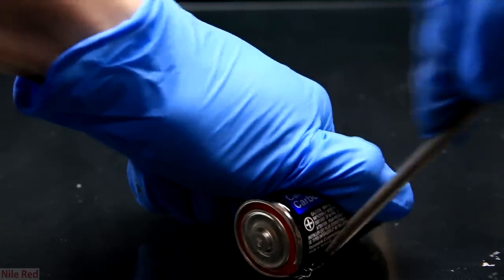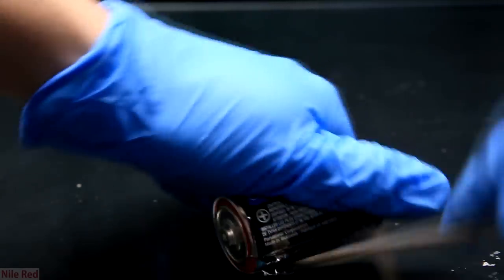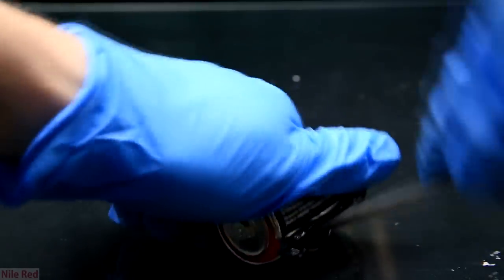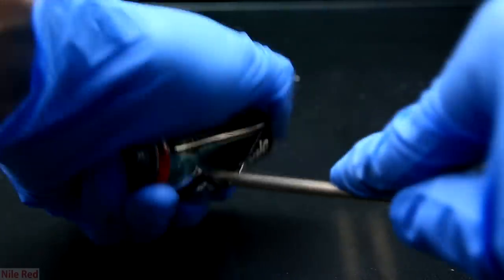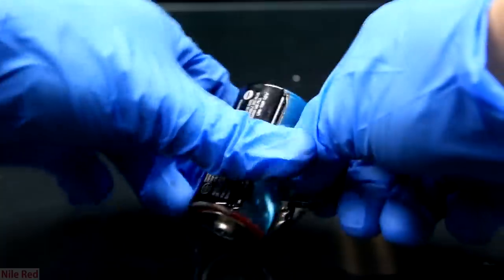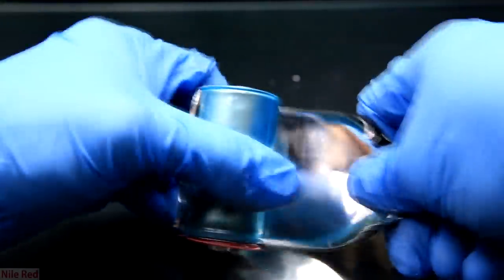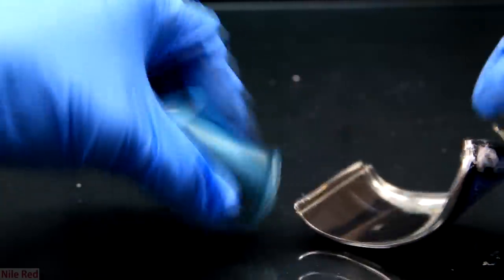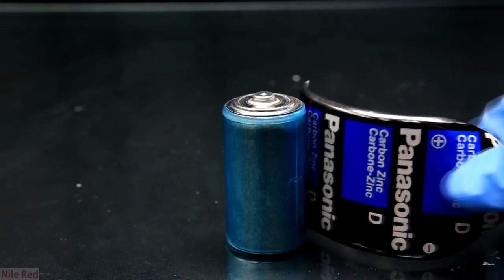So instead of forcing things you need to push with the screwdriver and unslip one from the other. This really doesn't take much force and once this is done the battery casing comes off pretty easily. This battery casing is kind of useless and I just tossed it in the garbage.